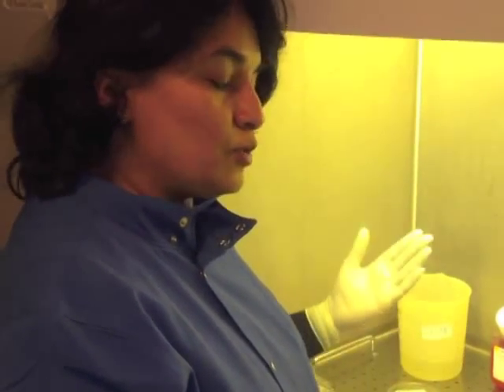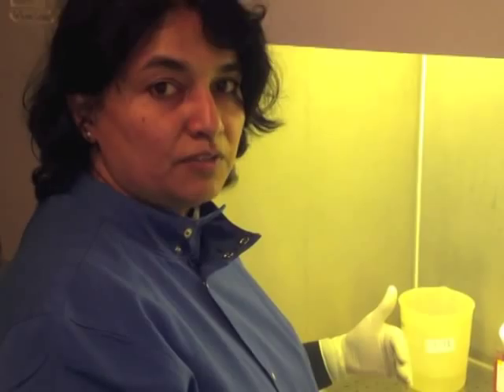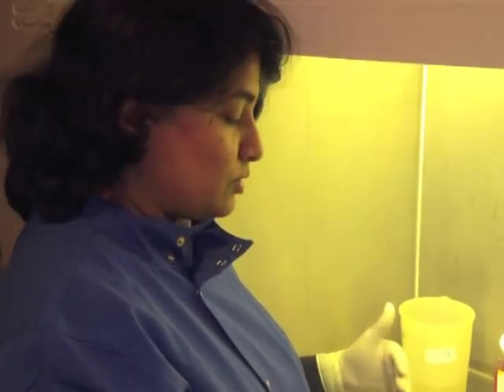So now I'm going to show you how to do the dilutions. We've discussed this in class already. We've worked out the calculations that you need to go from a stock solution to the final concentration of drug that you require.